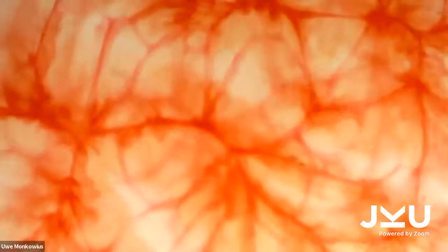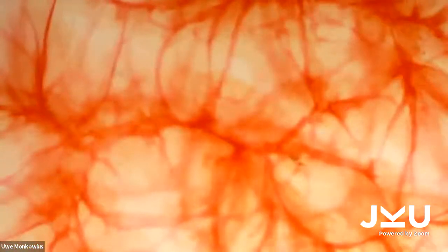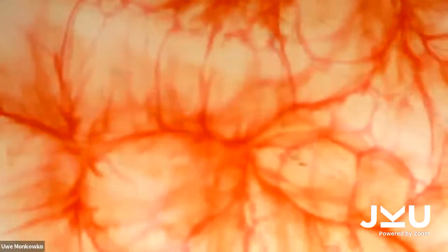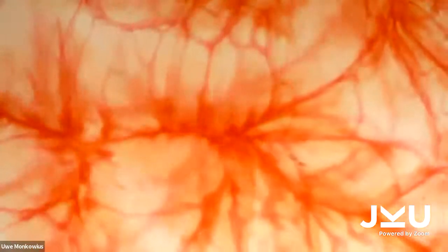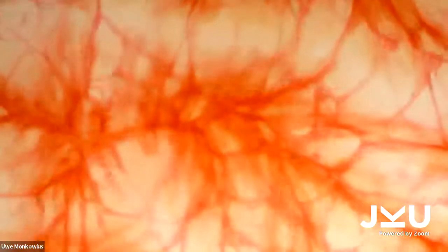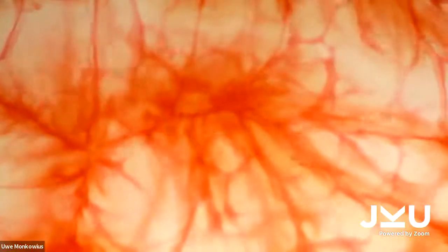Now you can relax a little bit, enjoy the beautiful pattern on this beautiful Sunday morning. In between, we will prepare some other experiments for you.